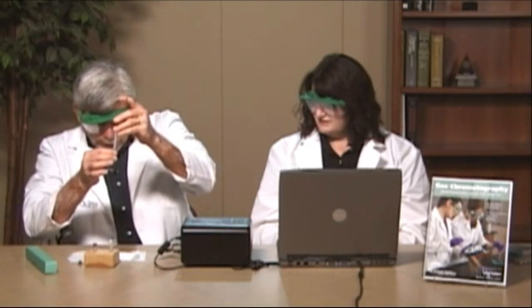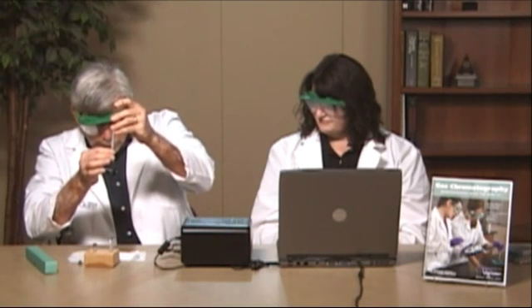He's pulling some of the sample through. And now what I'm doing here, very roughly, is getting about 0.2 microliter of liquid from my little vial to inject into the Mini-GC. This is one of the syringes that come with this device and we pop it into the injection port and push it down.